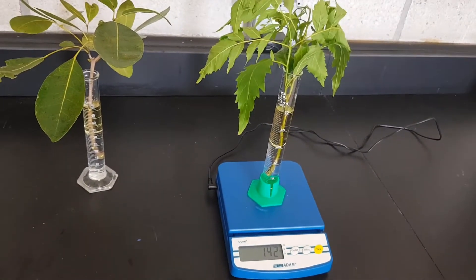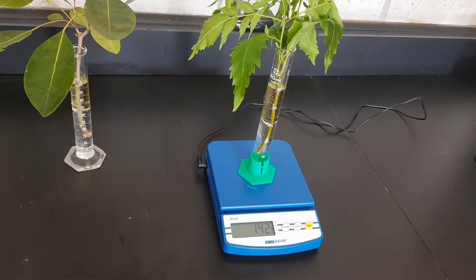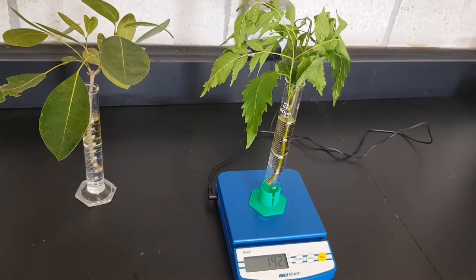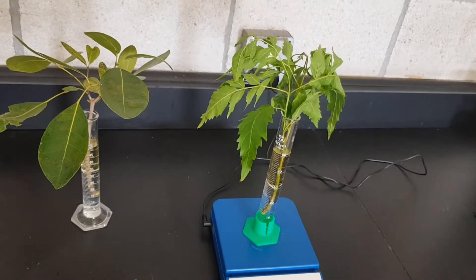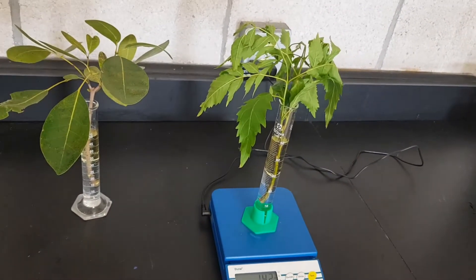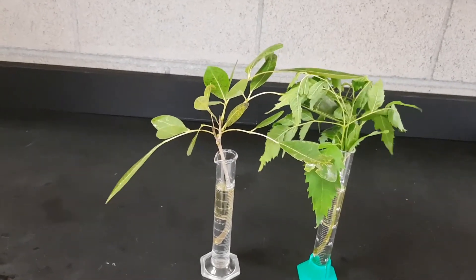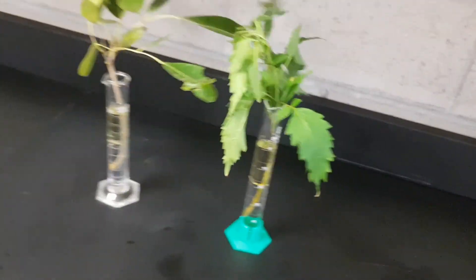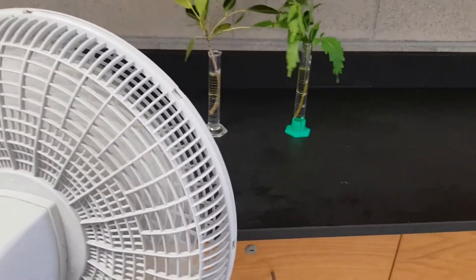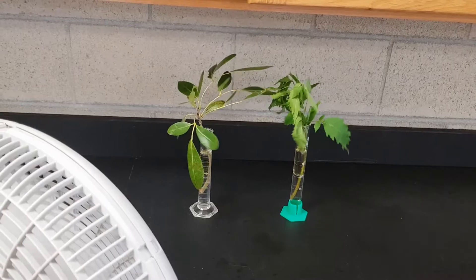The plants are pretty much similar in terms of number of leaves and also mass. What we're going to do now is put these into various environments. Today I'm going to look at wind — you could also look at light or humidity depending on what you want to do. I'll be using a regular fan for the windy environment, and the plants will be here for 24 hours under this condition.